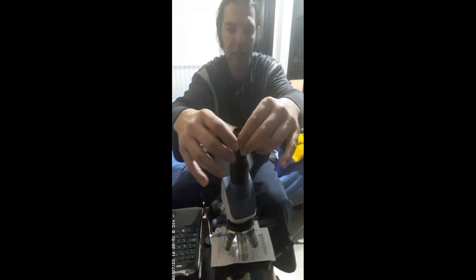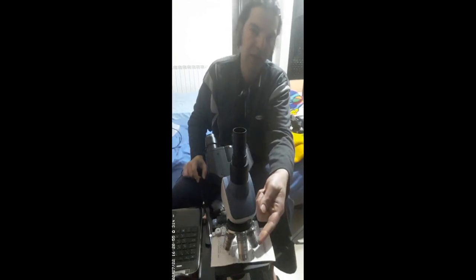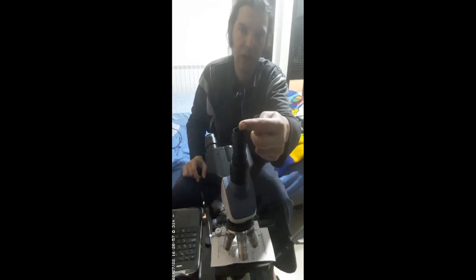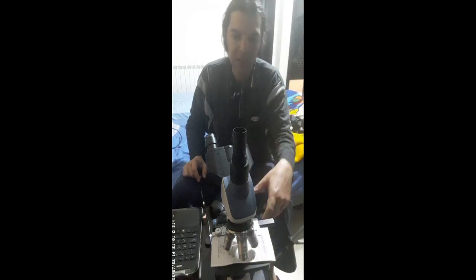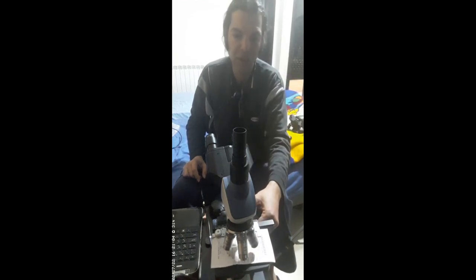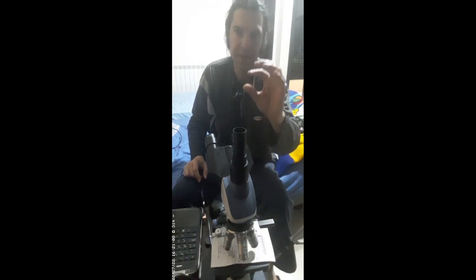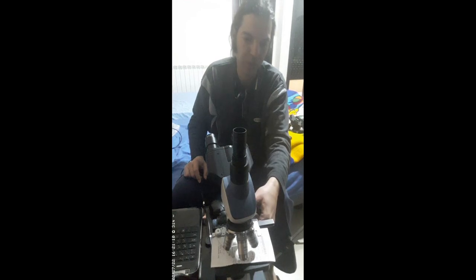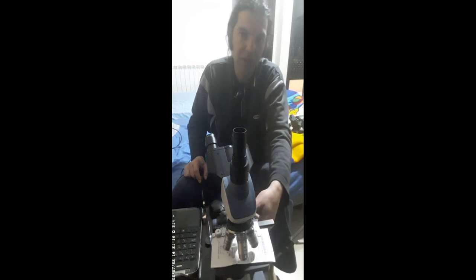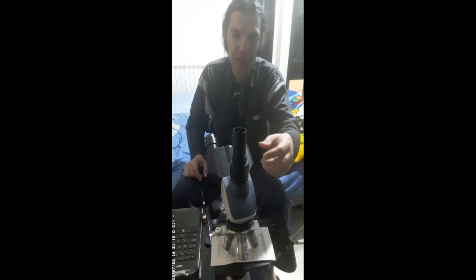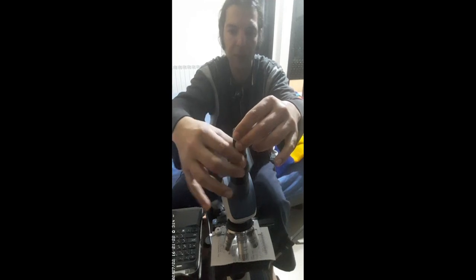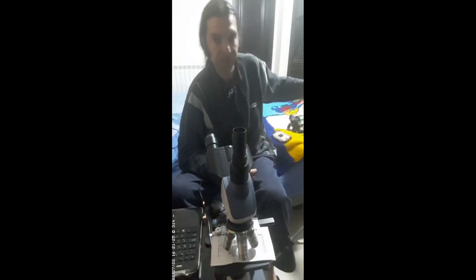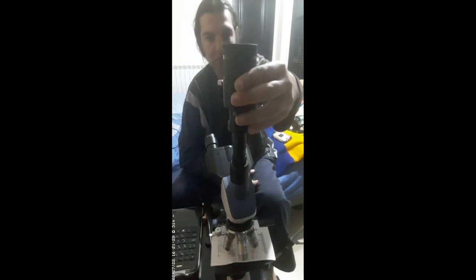Let me just remove this screw over here, which you can manage how high you can raise it. It's important because you need to focus. This is the lens of the objective and here you have your eyepiece, so you have to raise it and lower it plus the stage. Depending on your eyepiece, how much you can raise the stage. The stage is going down and up, this is also a way to focus. We're going to install them back again.